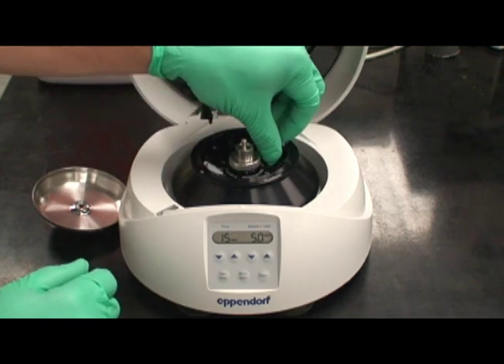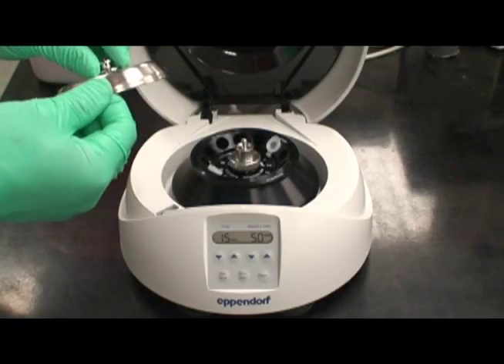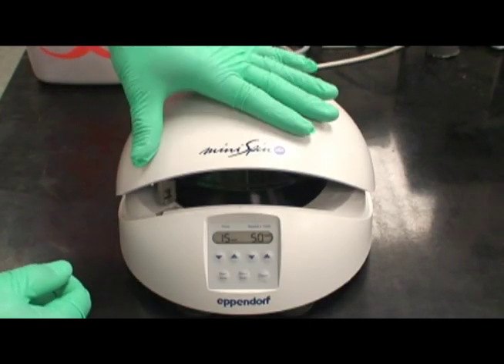If the rotor is not properly counterbalanced, it can be damaged. Once properly balanced, make sure to replace the metal lid and close the device.